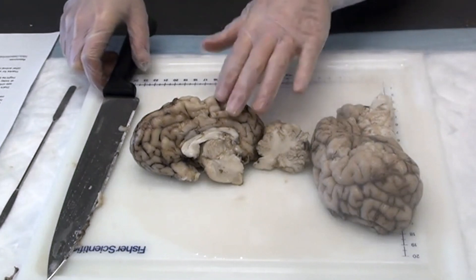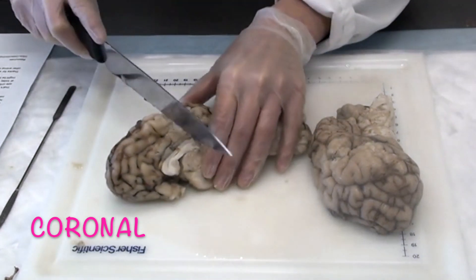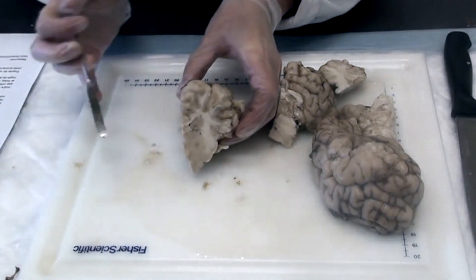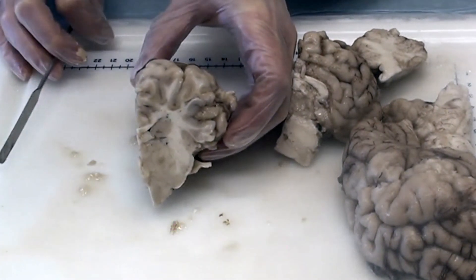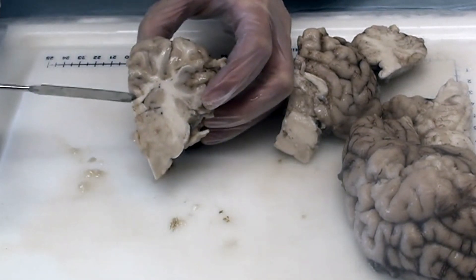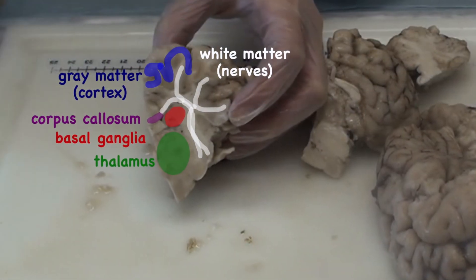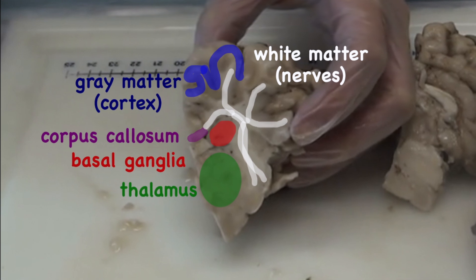Now we're going to cut one of these pieces of the brain in half the other way. We call this a coronal cut. Inside you can see these darker structures — this is called the basal ganglia. Basal ganglia are important for a lot of things including movement, learning, habits, and emotion. Here we can see the corpus callosum again in the middle. We can also see the white matter where brain cells from inside the brain are sending signals up to the gray matter on the outside of the brain. That outside layer of gray matter is called the cortex. We can also see the thalamus, which collects information from your five senses and sends it to the rest of the brain.